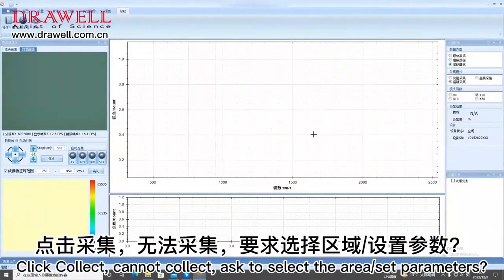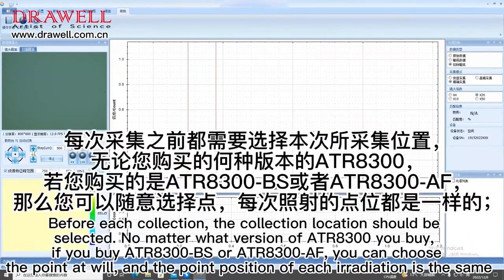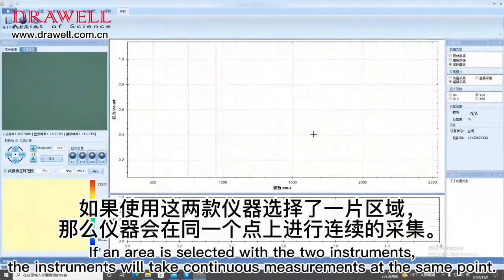Click collect, cannot collect. Ask to select the area and set parameters. Before each collection, the collection location should be selected, no matter what version of ATR8300 you buy. If you buy ATR8300 BS or ATR8300 AF, you can choose the point at will, and the point position of each irradiation is the same. If an area is selected with the two instruments, the instruments will take continuous measurements at the same point.